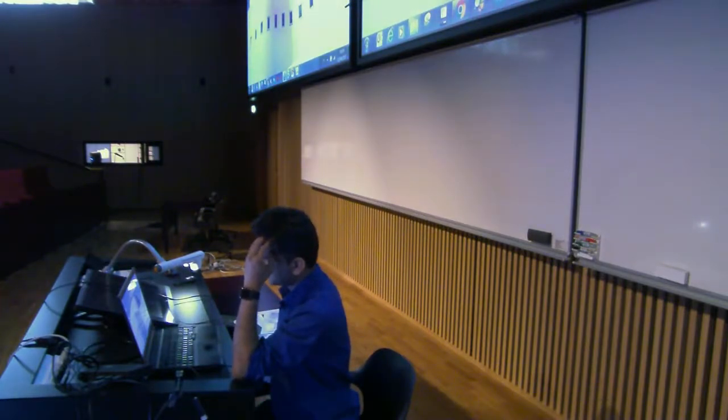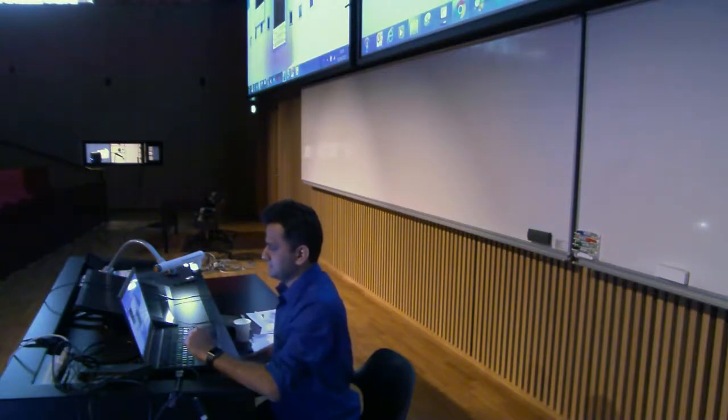It is always good practice to duplicate your image, okay? So go to image and say duplicate. So now it will be duplicated. Duplicate hyperstack, meaning that I just want to duplicate everything here, okay? So say fine. Okay. So this is the terminology. So C is channel, Z is different Z stack, and T is time point, different time point.